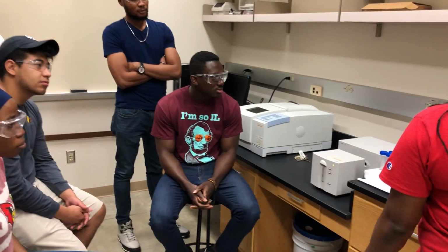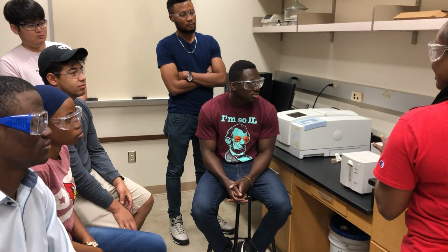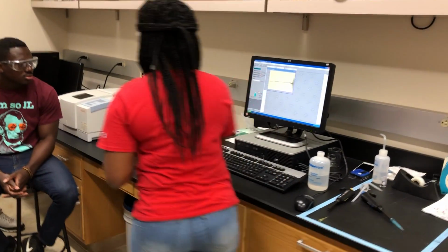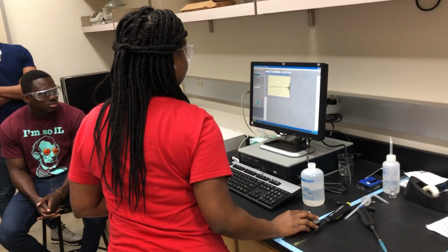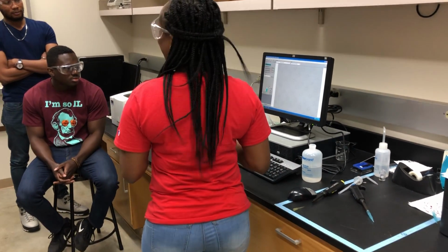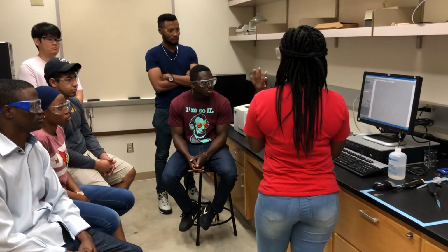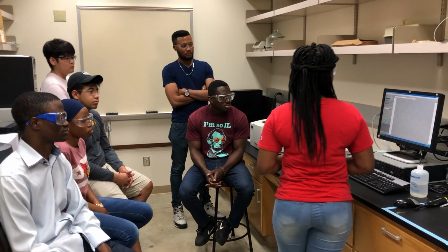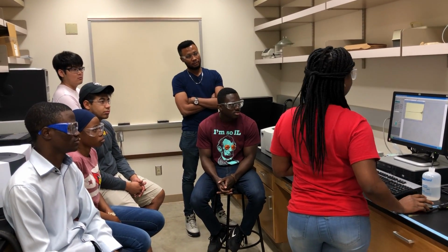That is what we're expecting because it's just water. When this is done, it subtracts the solvent from your nanoparticles. Cool, this is not good, so we have to try again. We want to have water subtracted from our nanoparticles, so that we get only the signal of the nanoparticles. So this could be okay for a blank.